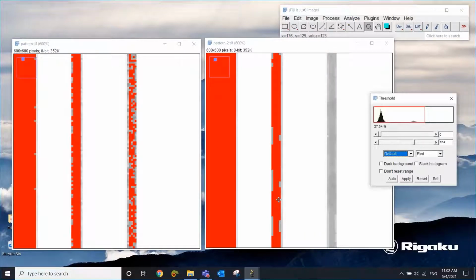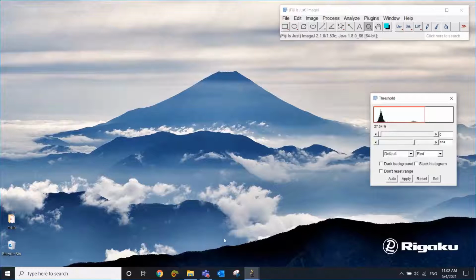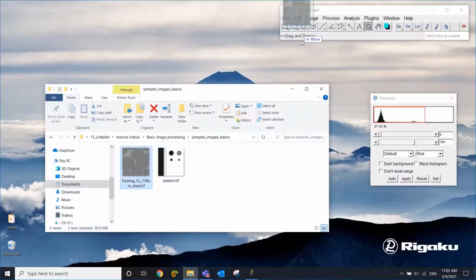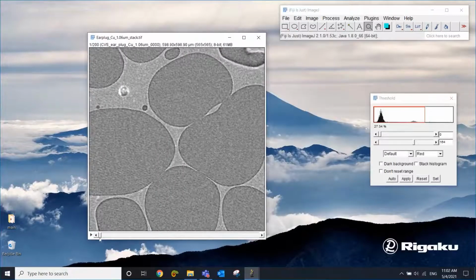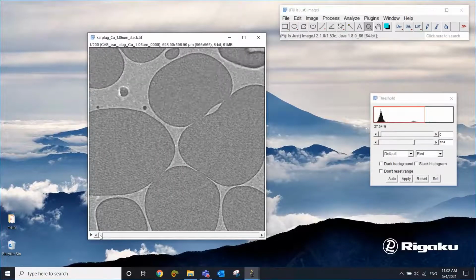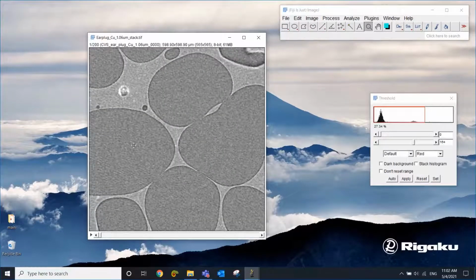Okay, so we're just doing this on this simple pattern, but let's do the same thing using an actual CT scan. So let me bring this guy in. So this is a CT scan of a foam material, and it's a CT scan meaning that it's a stack of multiple 2D slices. Okay, and the darker gray area is air, and the lighter gray area is the polymer. Let's say we want to segment those two phases into two so that we can maybe quantify their volumes.